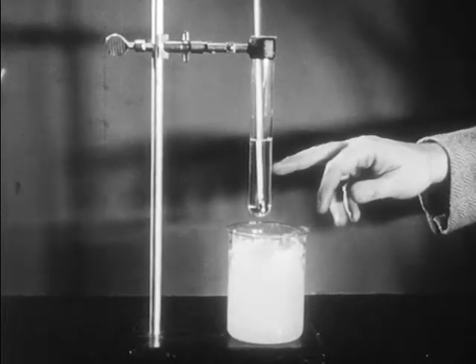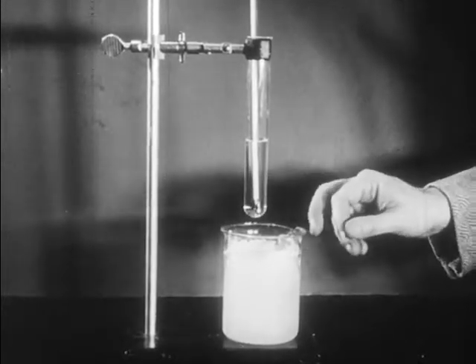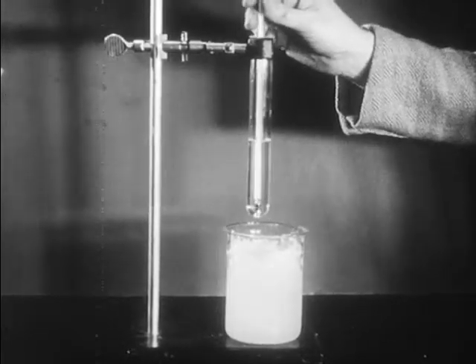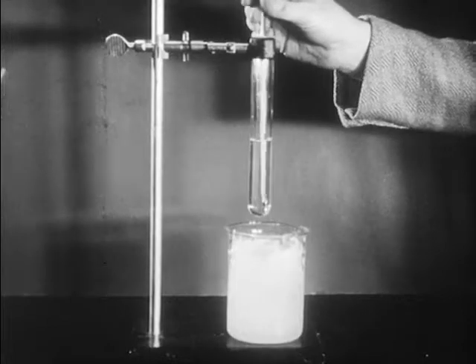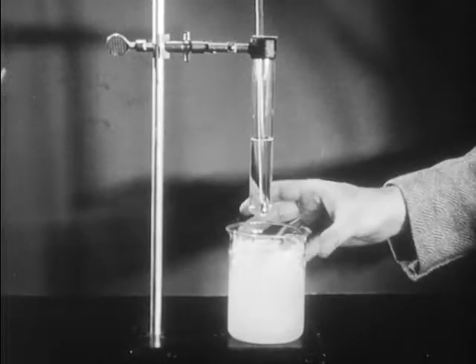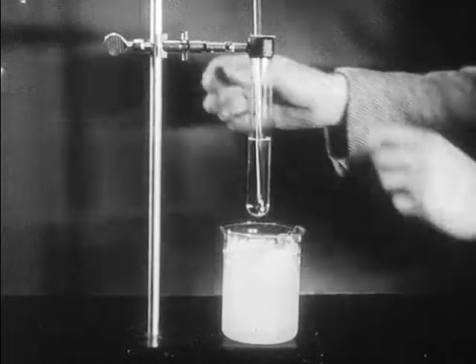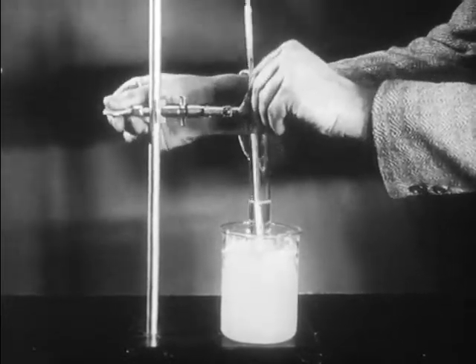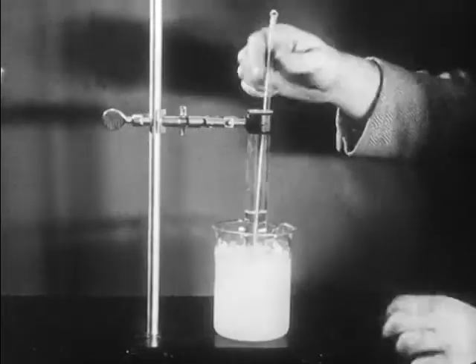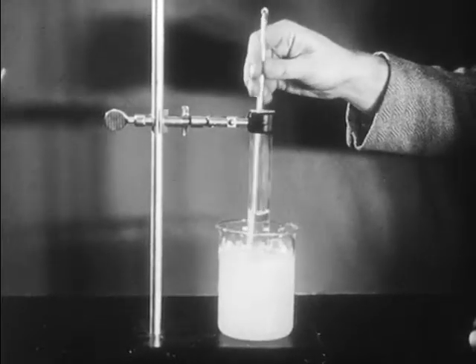In this test tube, I've placed some distilled water, and in this beaker we have a mixture of ice and salt and water. We're going to determine the freezing point of pure distilled water on this thermometer. We know this freezing point ought to be 0 degrees, but it's possible the thermometer calibrations might be slightly in error, and we need to know what the actual freezing point is as measured by this thermometer. To do this, we'll lower the test tube containing the thermometer and the distilled water into the ice-salt mixture and stir until the water in the test tube freezes.